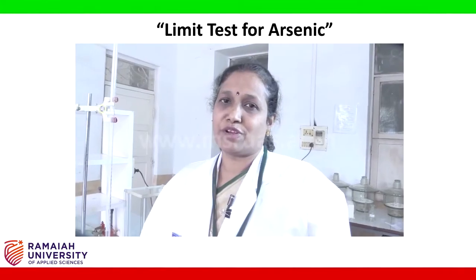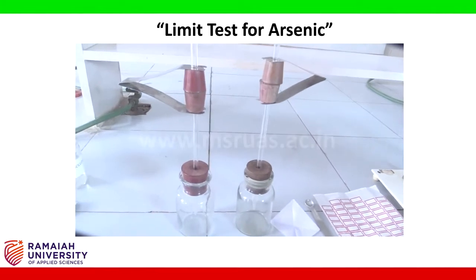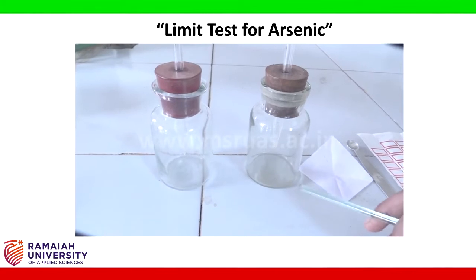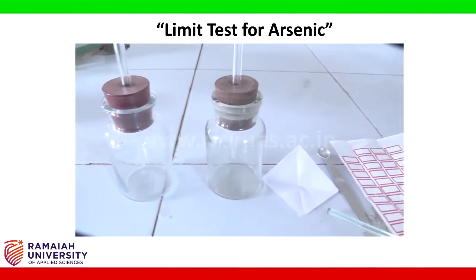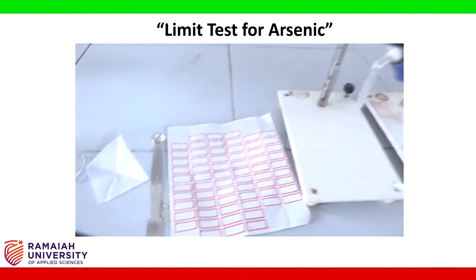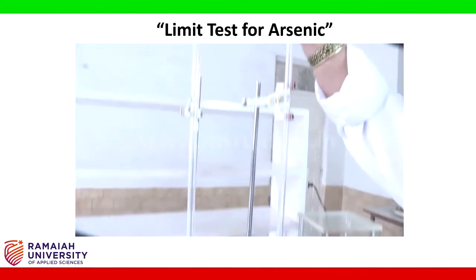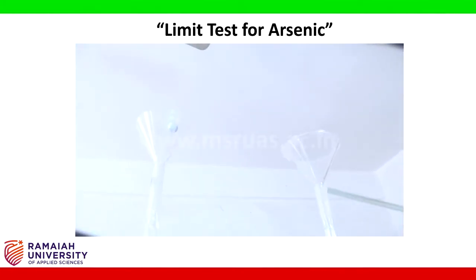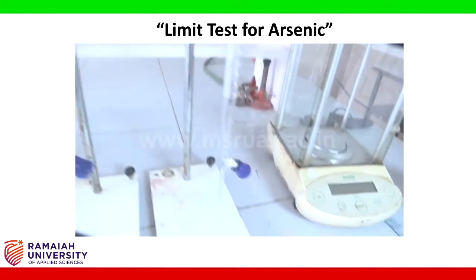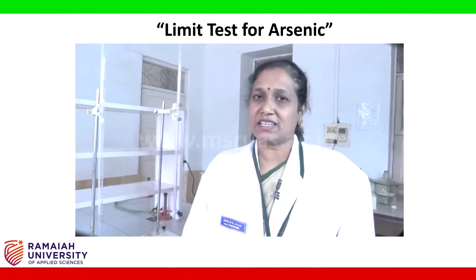The apparatus required for this experiment are a pair of arsenic apparatus, one for the standard and one for the sample, butter paper, spatula, labels, burettes with burette stand, funnels for filling the respective reagents, and an analytical balance. Now we'll start the experiment.